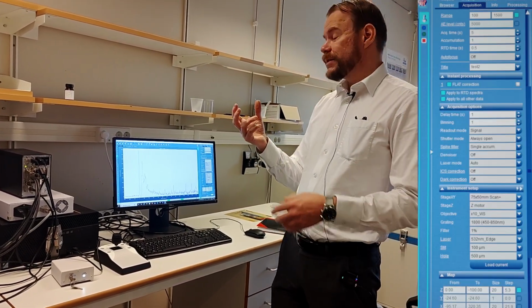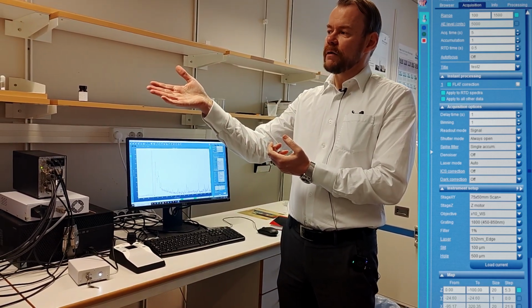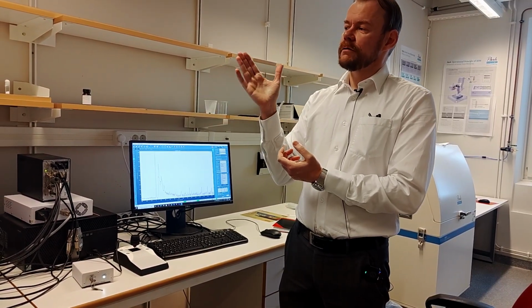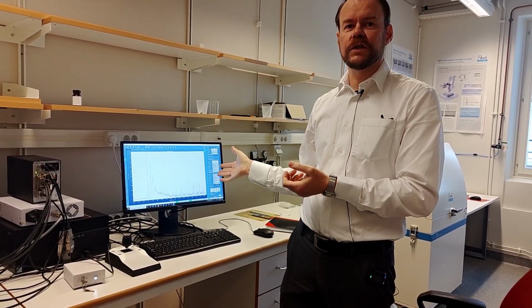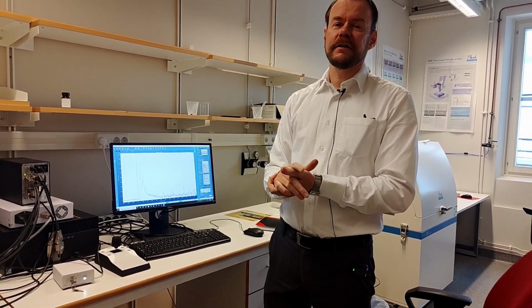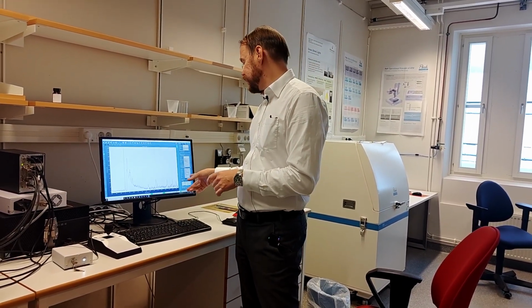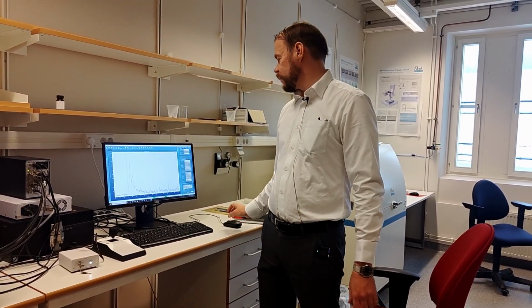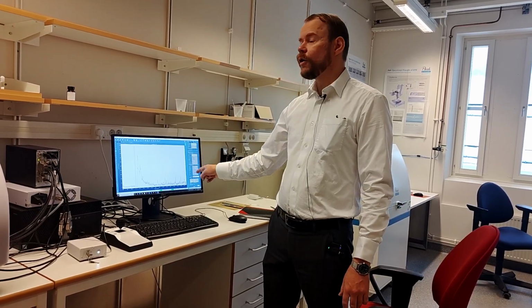So if we talk about the slit, the aperture is the aperture to the spectrometer. That controls the wavelength resolution on the spectrometer. If you choose a smaller slit, intensity will be lower, but resolution will be improved. For most users, you can just leave it on 100, that will be fine. That is like default, works in most cases. But the hole is important. The hole is that confocal aperture.